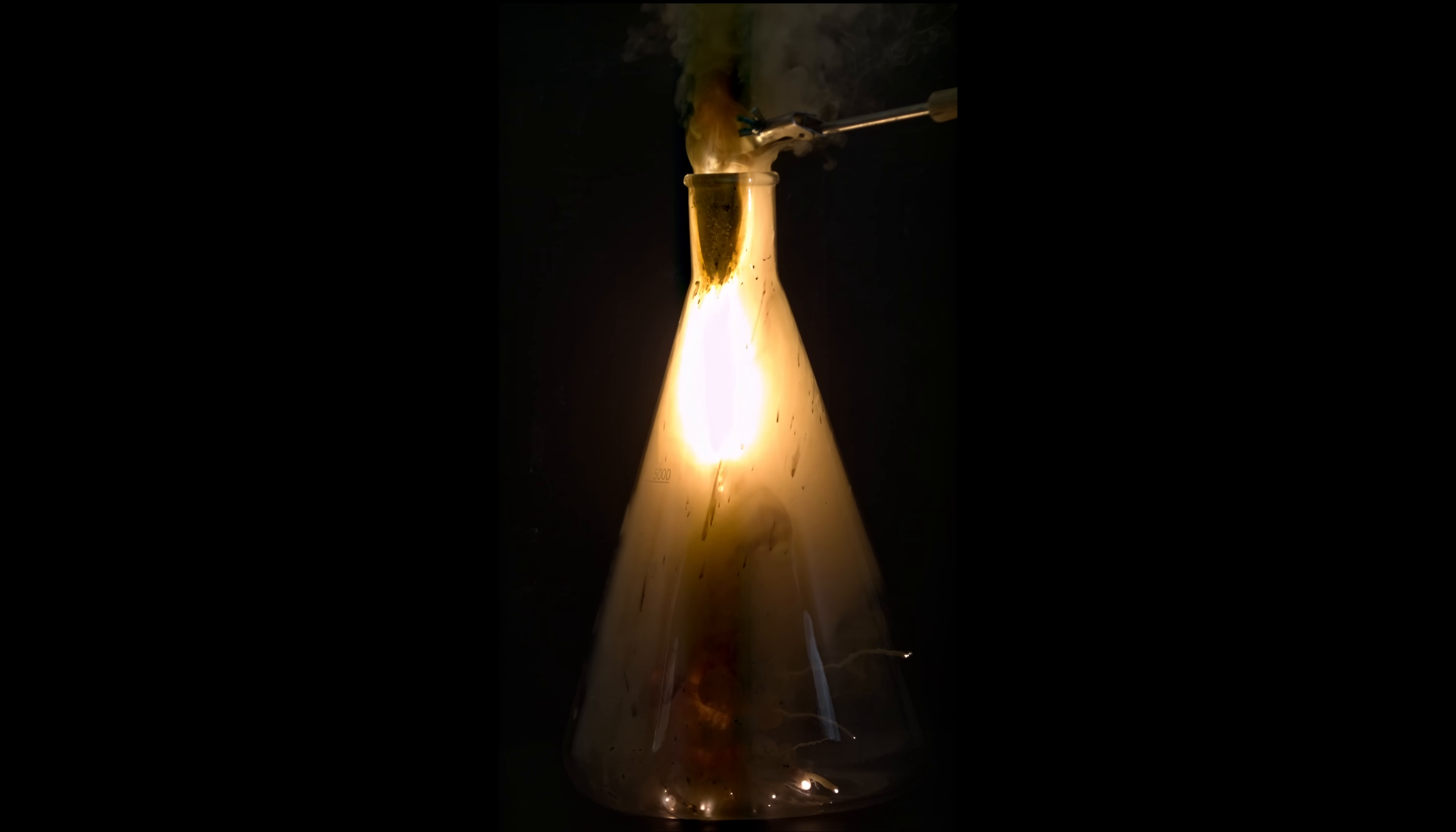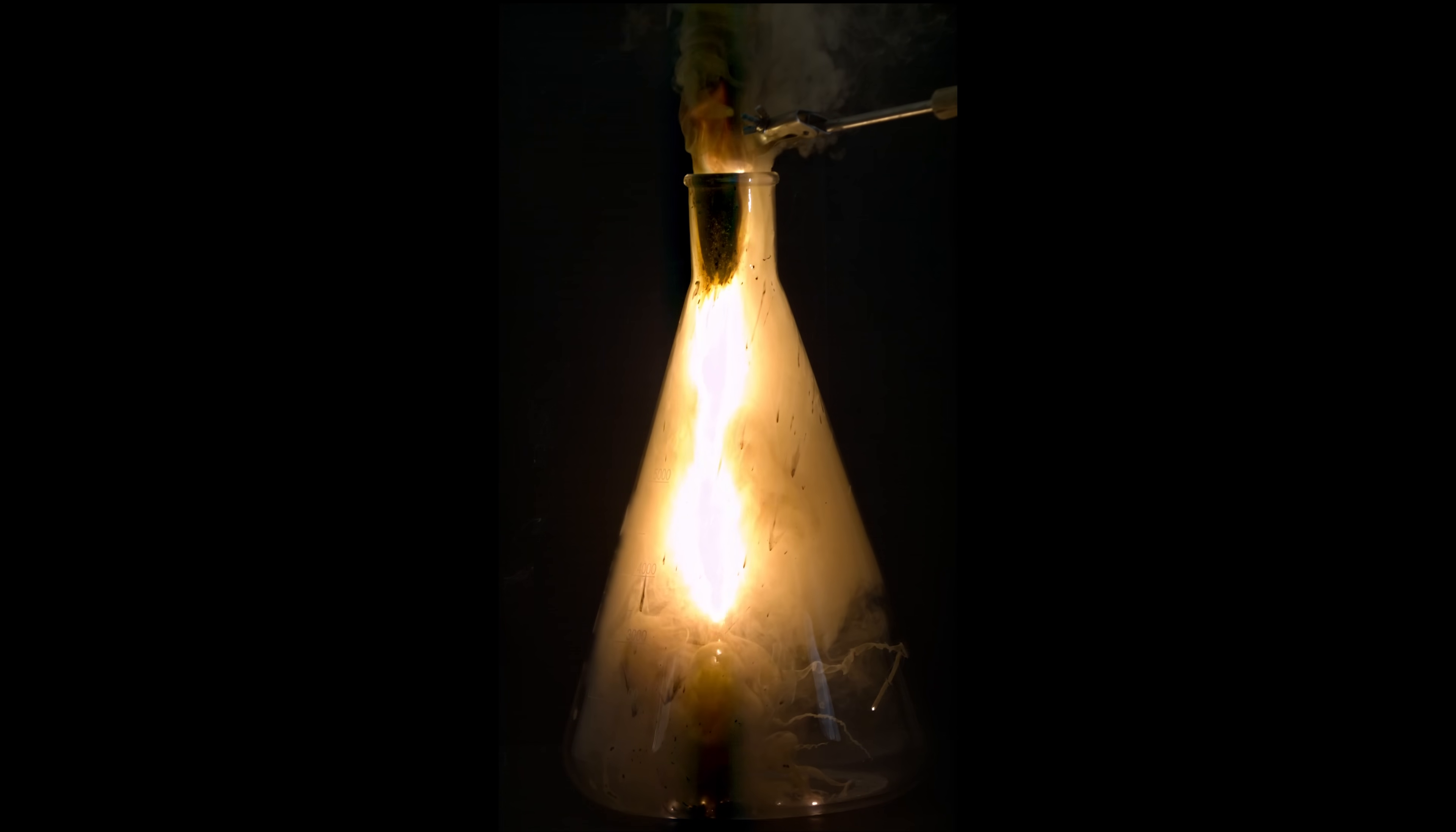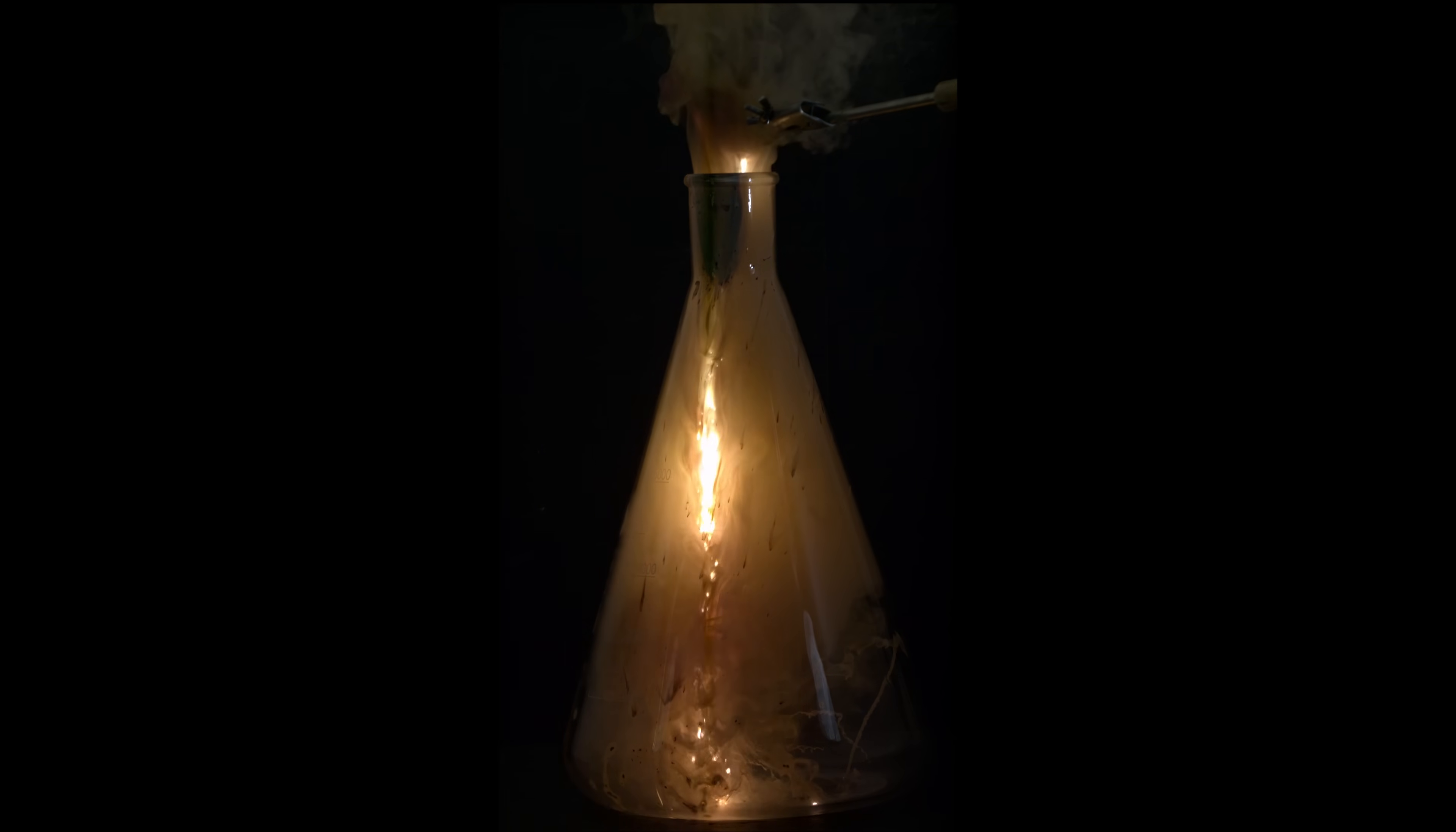In pure oxygen, as expected, the oxidation of lead occurs much more intensely, but how will this reaction proceed if I pour this powder into liquid oxygen?